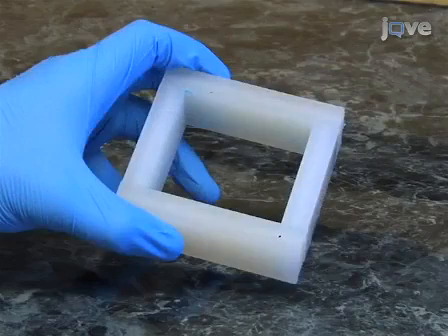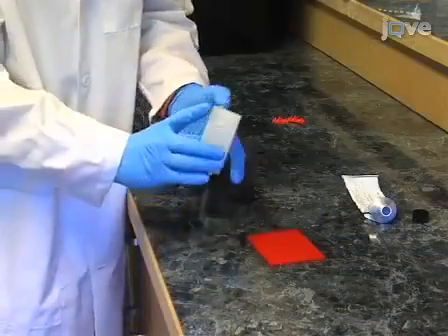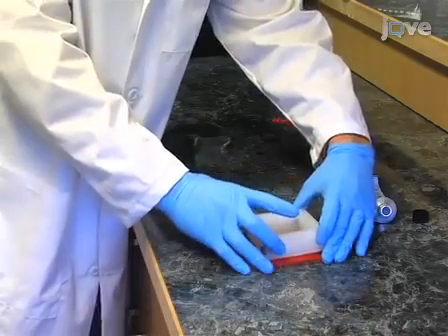Construct a box-shaped mold form using thin pieces of acrylic material cut to the desired dimensions. Make the bottom of the form by adhering it to a flat acrylic plate with vacuum grease.